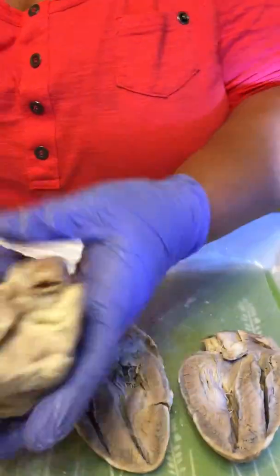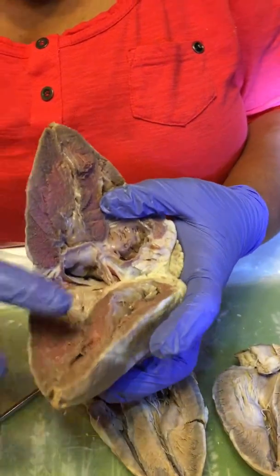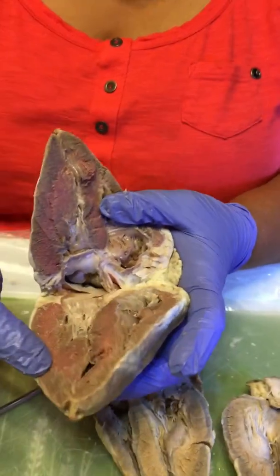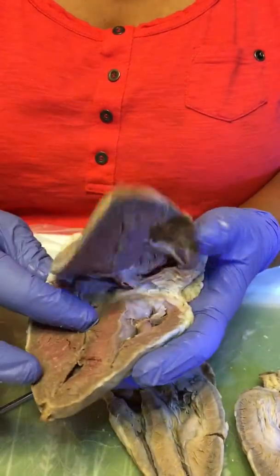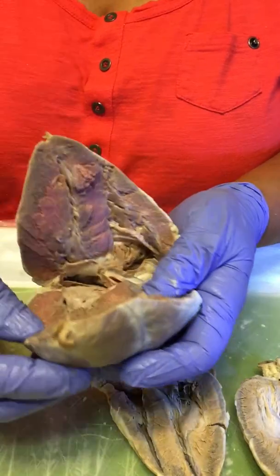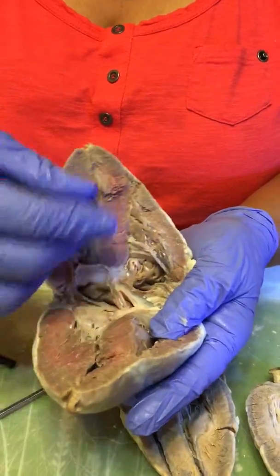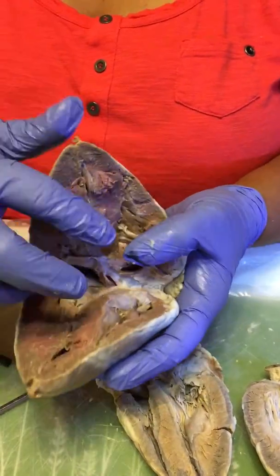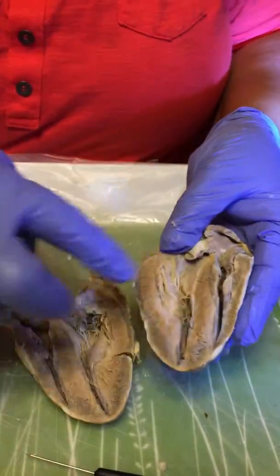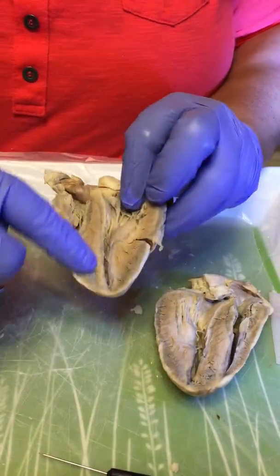And here we want to say, why are the muscles larger? As I said, this is going to be the left ventricle, and the muscles are larger because it requires three times more pressure to push that blood from the left ventricle through the aorta into the circulation of the body. So it has more pressure, and it requires a larger contraction to push that blood out. In between here is the interventricular septum, right here, where you would have the bundle of His conduction system in this area.